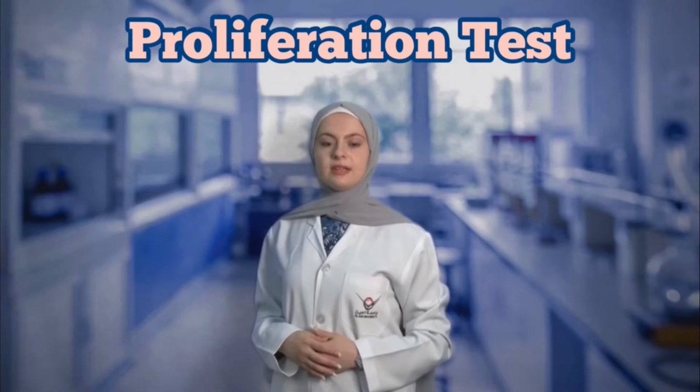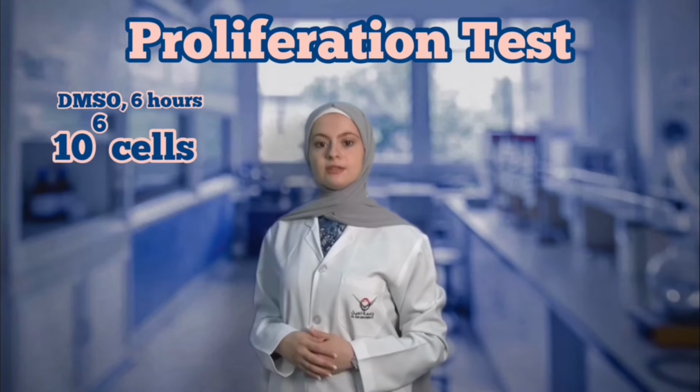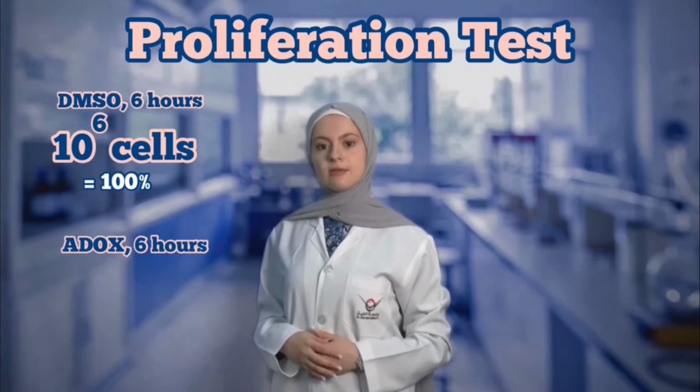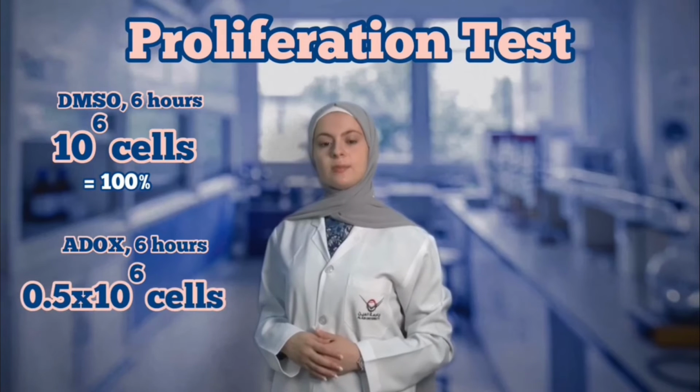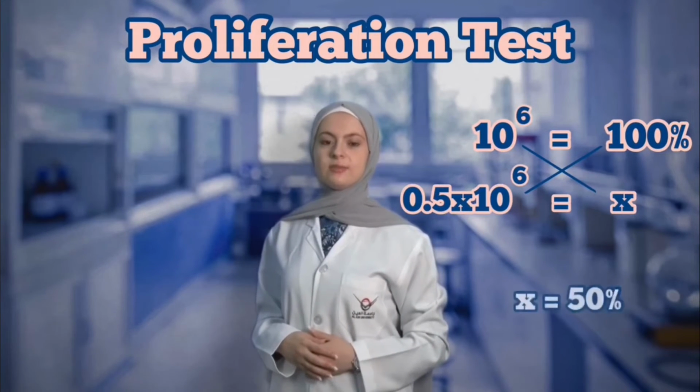For example, DMSO at 6 hours, there were 10 to the power of 6 cells, which represent 100%. Then, ADOX at 6 hours, there were 0.5 times 10 to the power of 6 cells, and by cross-multiplication, we got the percentage to be 50%. ADOX and roscovitine come in powder form.